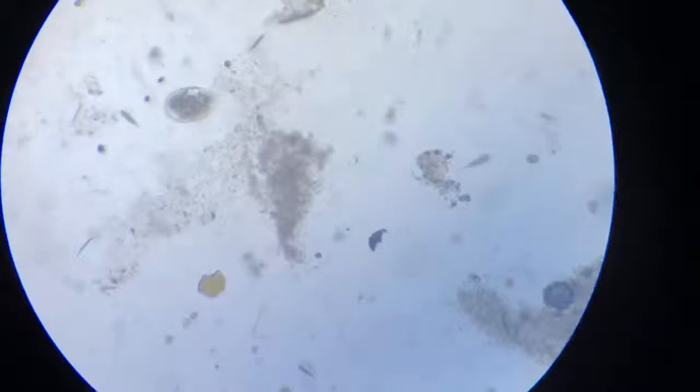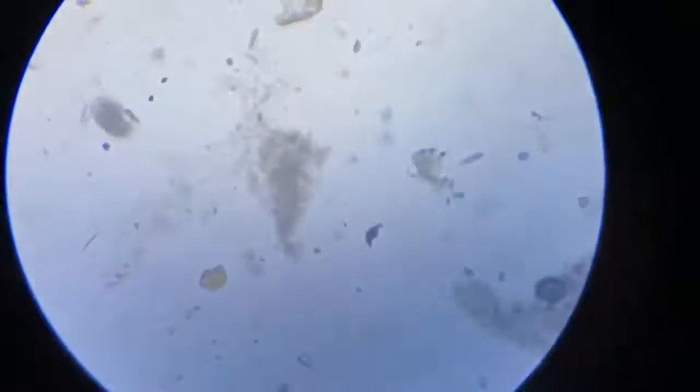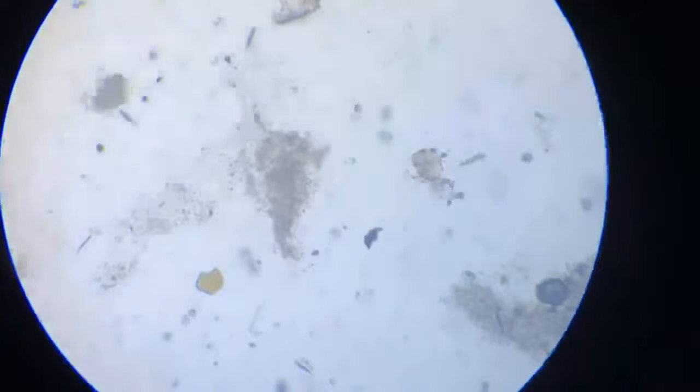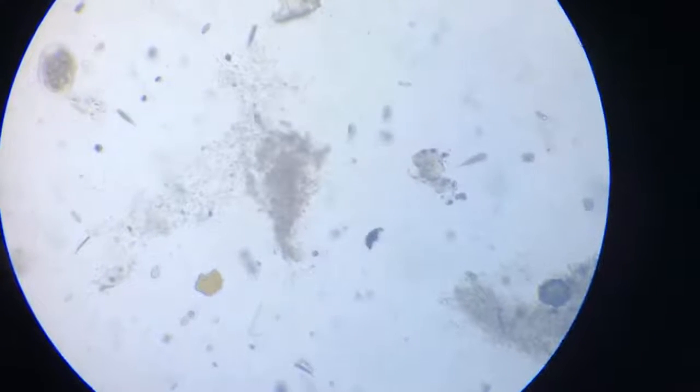Okay, so we go to some other organisms. We'll focus on some other part of the slide.